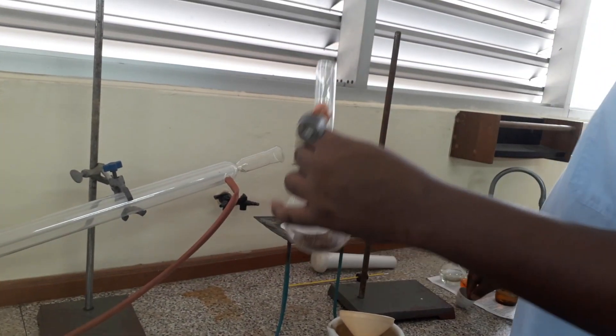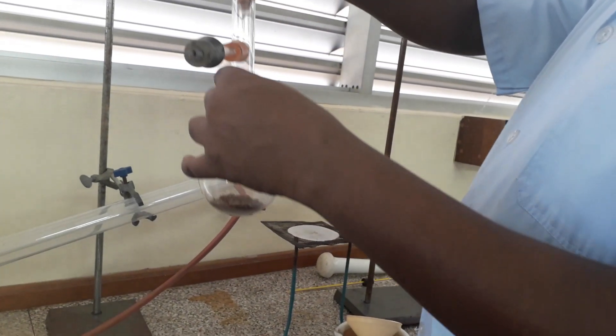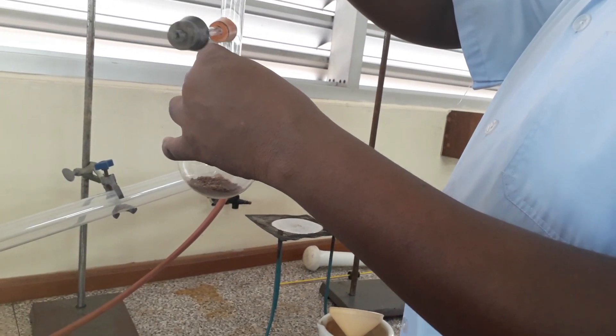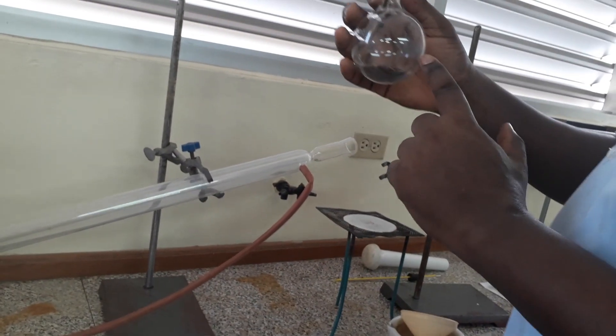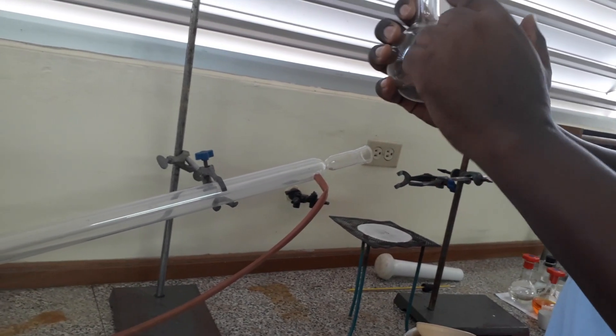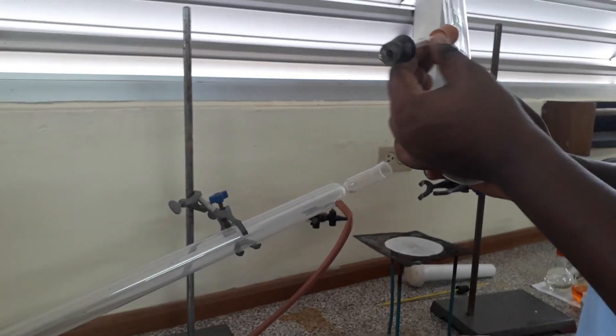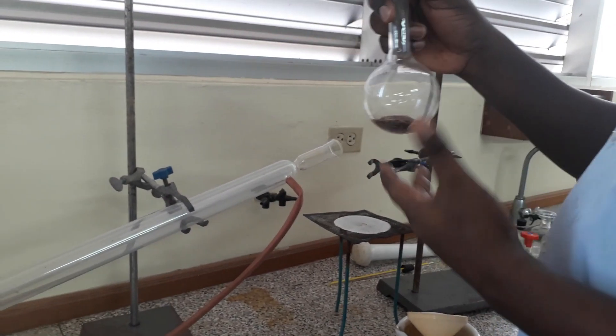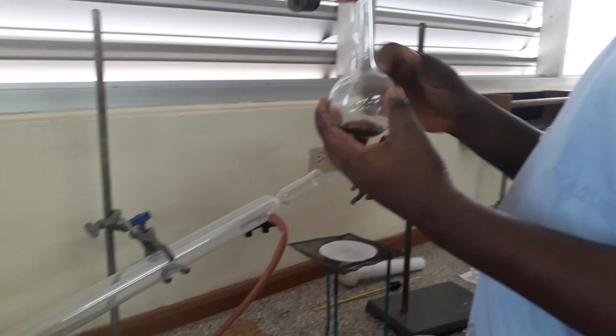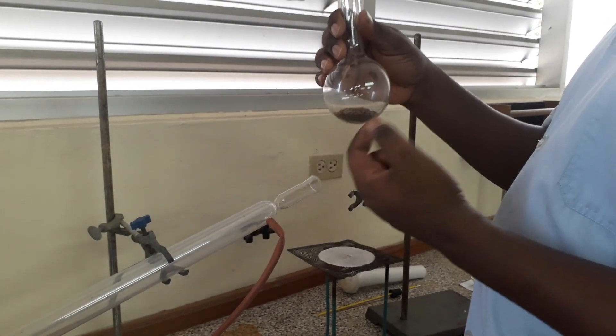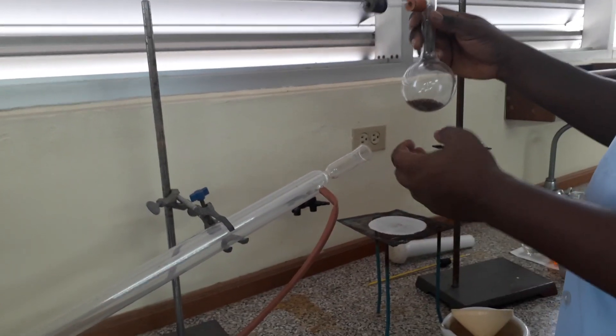I'm going to add a few pieces of pot, ceramic material, and that ceramic material will prevent the water and clove mixture from boiling up and over into the tube to the condenser. The pieces of pot help to break up the bubbles produced by the turbulence as you boil it.